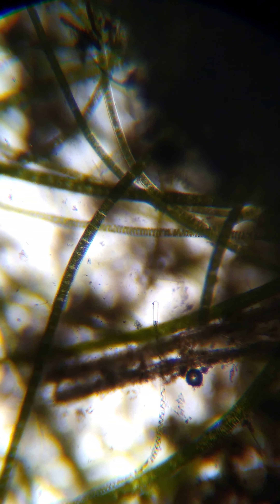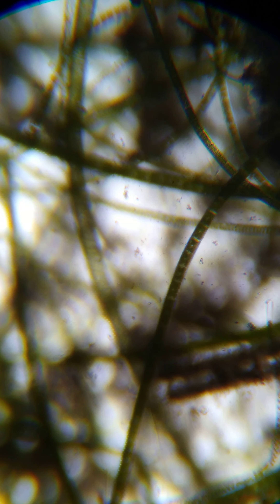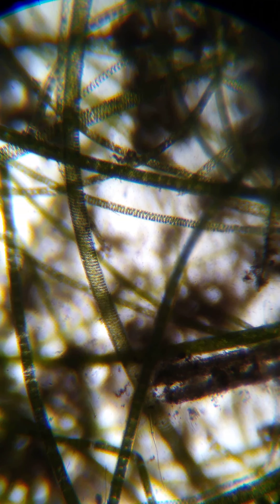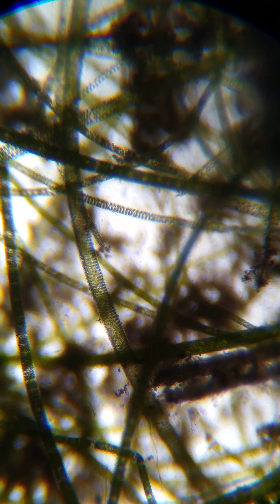Anyhow, I'm no expert on finding tardigrades, clearly. But this is algae. I am a huge fan of algae, because there are all kinds of crazy things that live in algae. There's something else there, I can't tell what it is. And there's something up here — oh, it's a wormy worm.